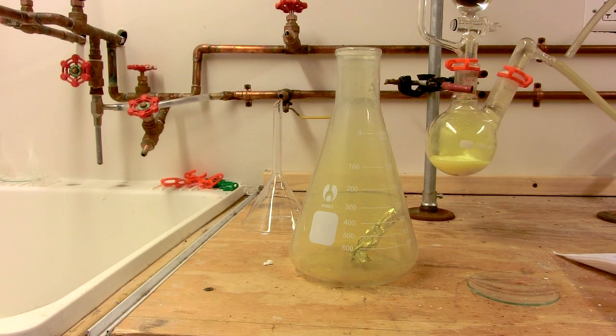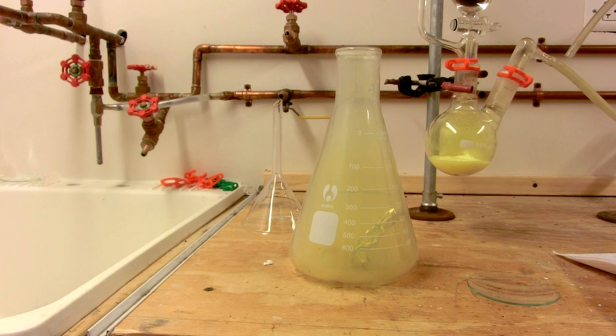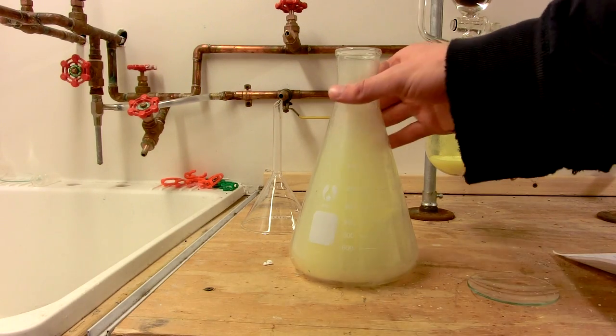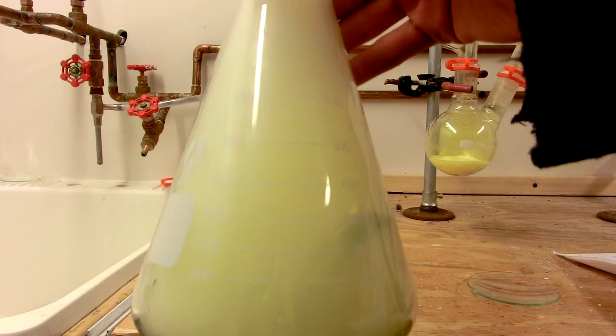You see the exothermic reaction beginning, filling the flask with a white smoke of aluminum trichloride, and using up the chlorine.